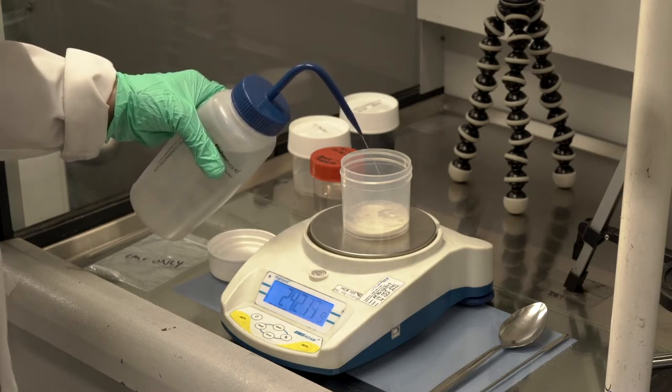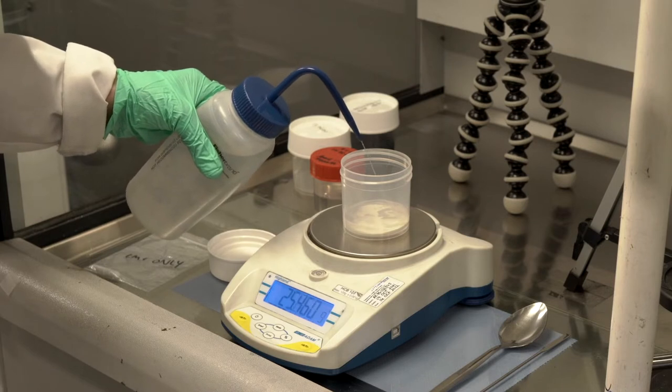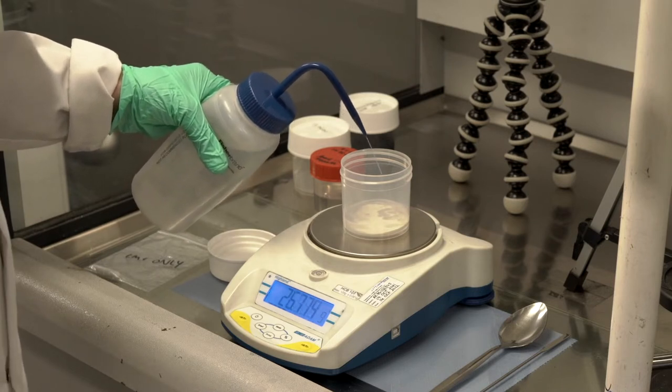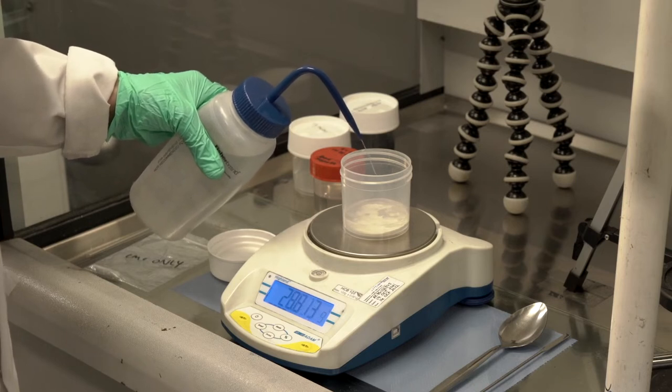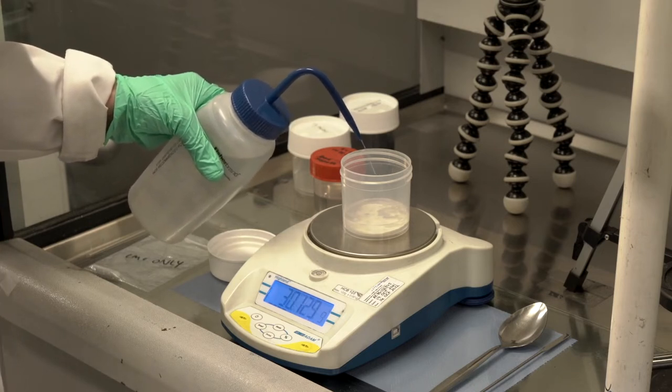I generally leave it at least overnight, return and inspect it, and give it another mix to make sure that there aren't some clumps that are more solid than others.